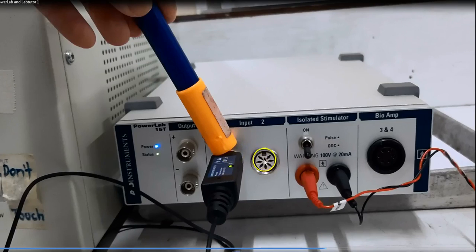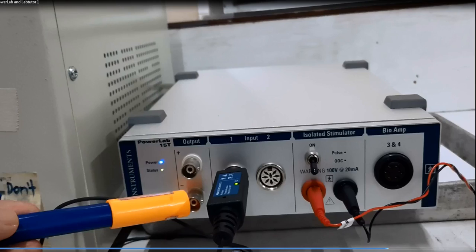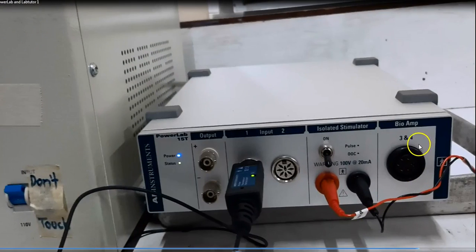We have two available input ports for this type of Power Lab. There are other Power Lab hardware that can have even a dozen of these inputs. For us, this is just a very basic setup. We only have two input ports. As you can see, one transducer is already attached to input port 1. Here we are pointing to the output port where you attach connectors going to the computer. And now for the rest of the ports, these are for other sensors that we can also attach to our subject.